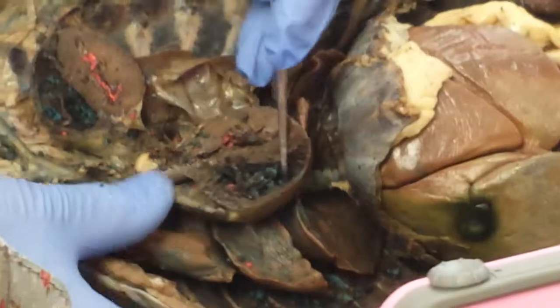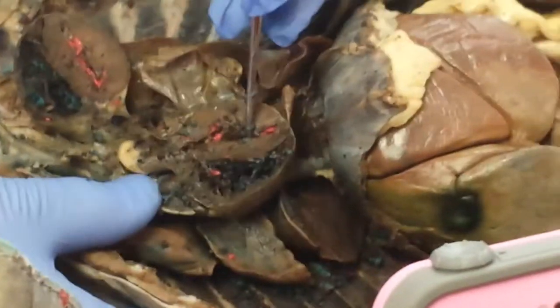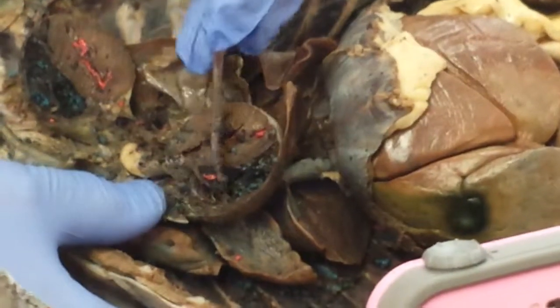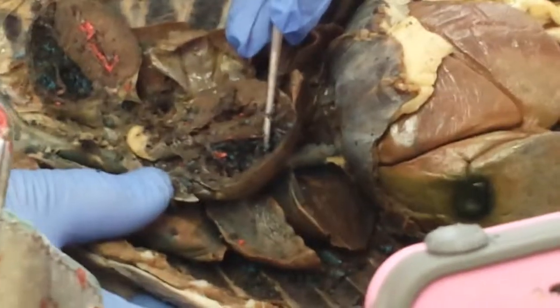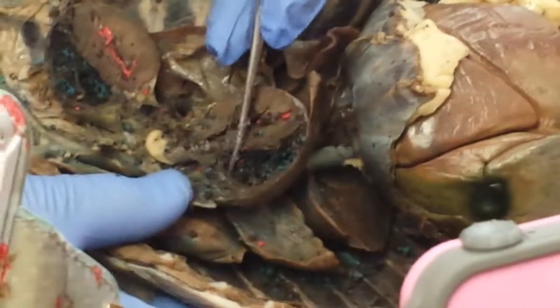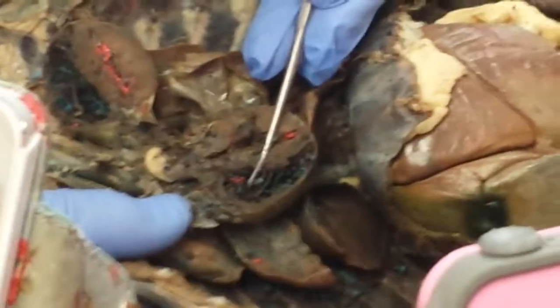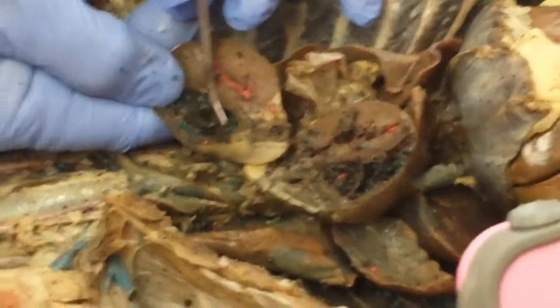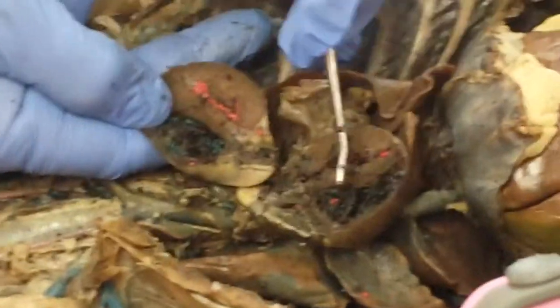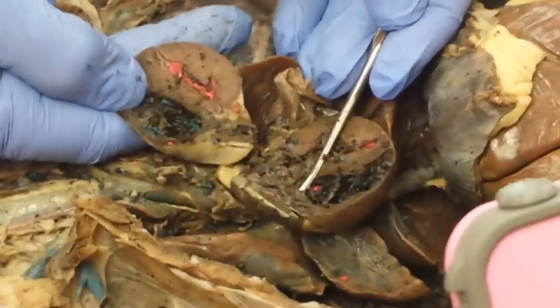Once blood enters the right atrium, blood will pass, generally speaking, passively by gravity. At least 80% of the blood from the right atrium passes into the right ventricle simply by gravity, gravitational pull. Over what valve? What's the valve that separates the right atrium from the right ventricle? Tricuspid. Although we don't see a really clear example of the tricuspid here, we see at least one leaflet right here. See that? That's one of the leaflets of tricuspid.